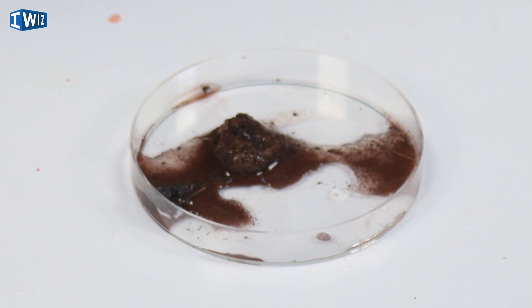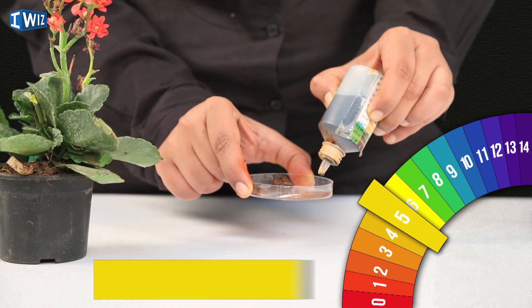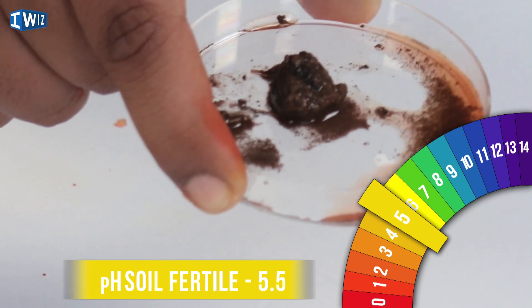Finally, let's talk about soils. Soil contains a lot of organic matter — dead and decayed animals — and bacteria feed upon this and, as they disintegrate it, the soil becomes quite acidic. So rich soil is usually acidic. Testing our soil sample confirms it is acidic. Not all plants grow well in acidic soil, so we have fertilizers that are quite basic. And if your soil happens to be basic, there are also acidic fertilizers available.